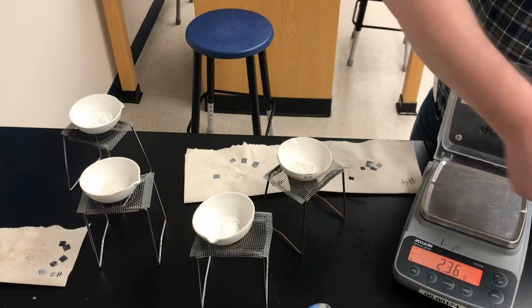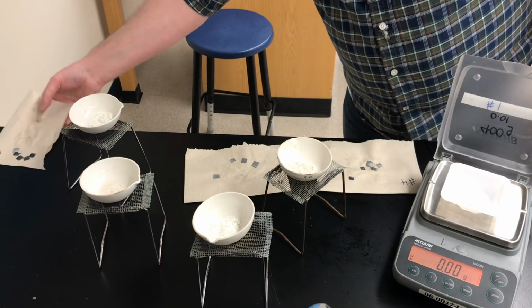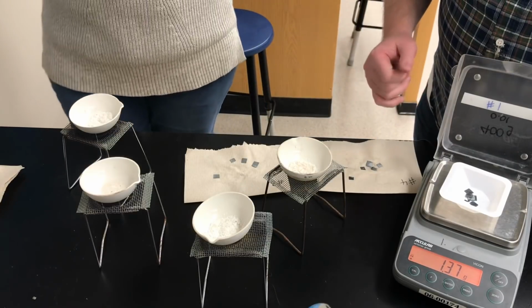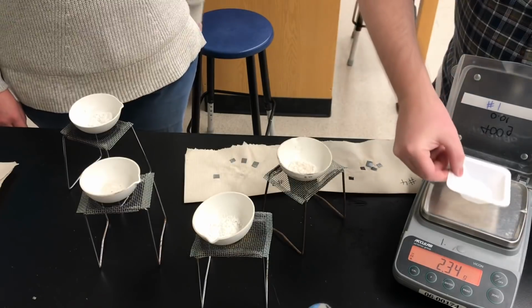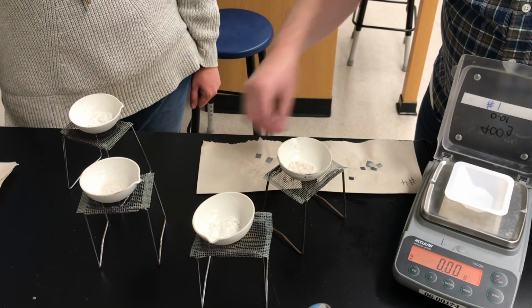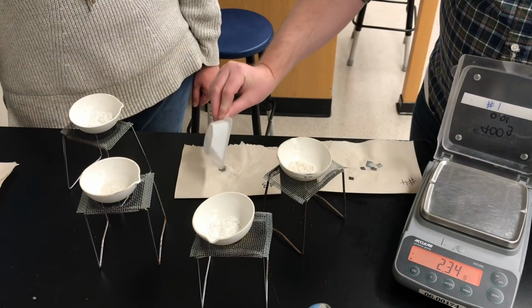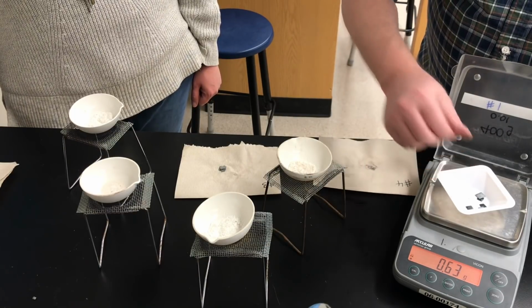All right, so now test tube 2, let me discard that and I'll re-zero the balance. Test tube 2, here's its zinc. Now again, the zinc was initially wet, but it's been sitting on paper towel and we're pretty sure it's dry. But if it were a little bit wet, that would also be a source of error. So there's the leftover zinc from test tube number 2. And now test tube number 3, we'll zero the balance again with the weighing boat. And here's the leftover zinc pieces from test tube number 3. That's it. So again, record the mass, and then you're going to be able to calculate the mass of zinc that reacted in the experiment. And here's our test tube number 4, the leftover zinc.